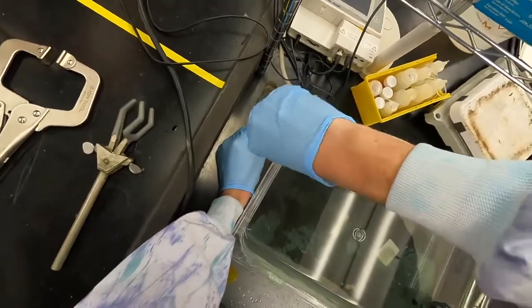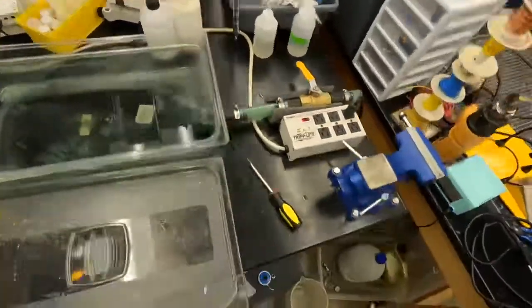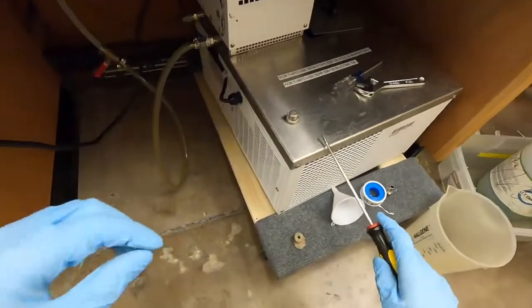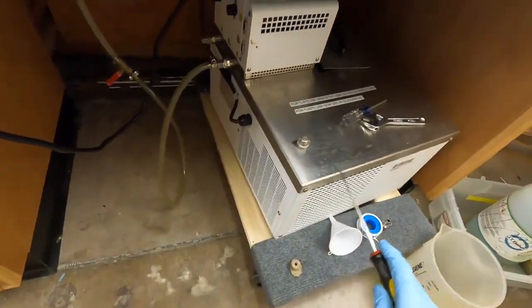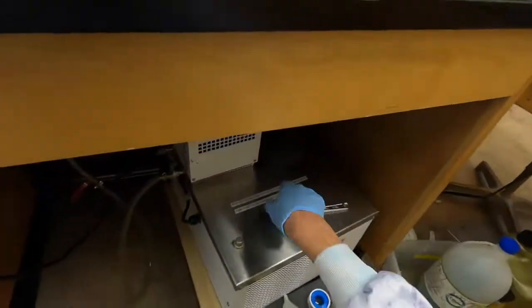These go through the table and then down to this thing. This is the cooling unit - this actually cools the antifreeze and cycles it through.